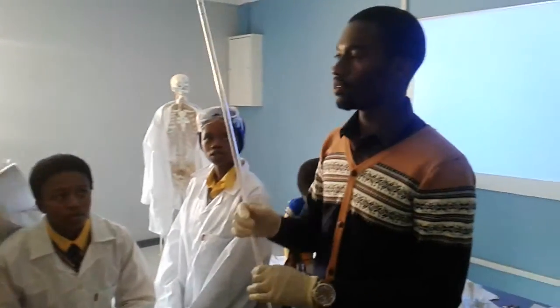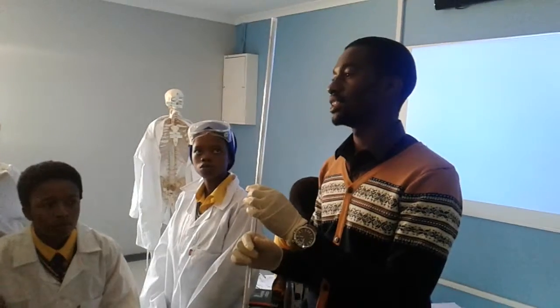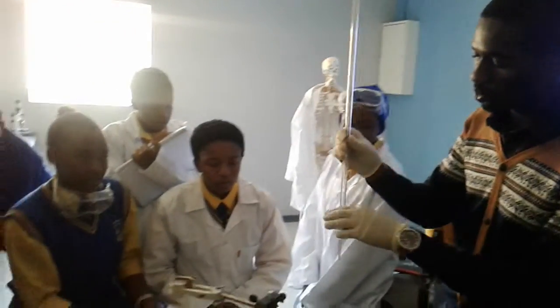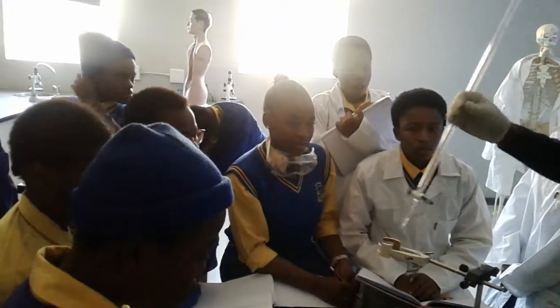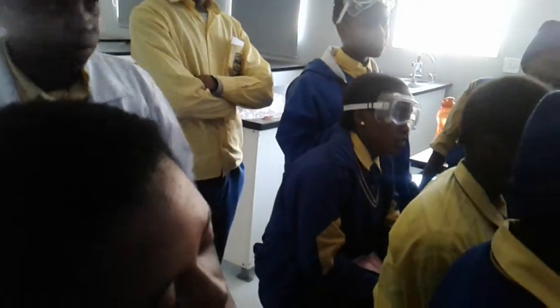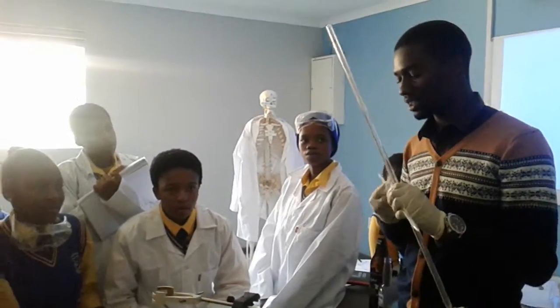It's to measure the volume of the known concentration. So, the function of a burette is to measure the volume of the known concentration and to also put it inside the flask so that it doesn't spill. So, guys, people are going to get confused between these two. What is this called? Burette. Nice. What is this called? Thermometer. A thermometer measures the temperature.